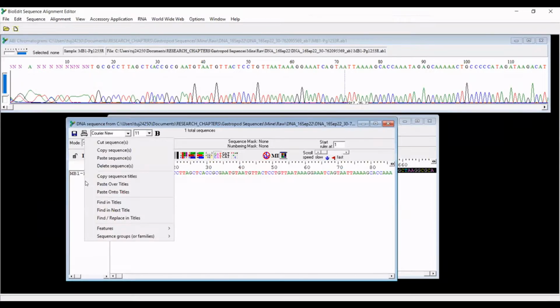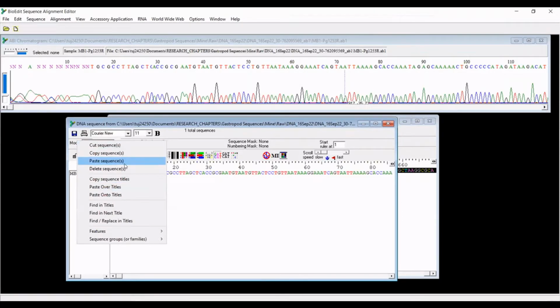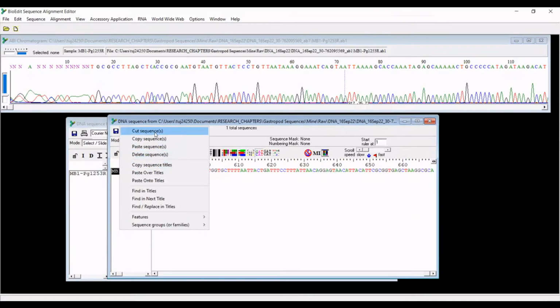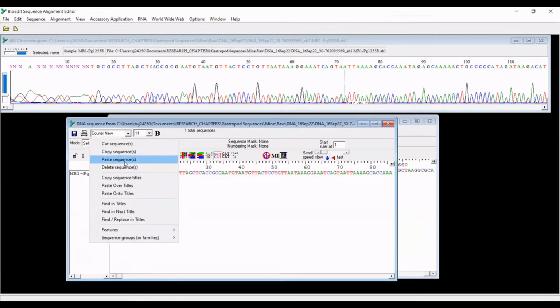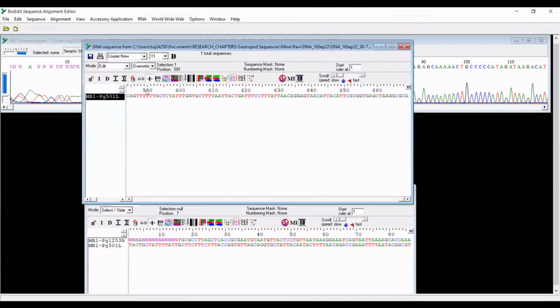So what you want to do is, oops, sorry, I'm right-clicking on this region on the left here. And I'm going to say paste sequences. And that did not work. So I think what I actually have to do is copy sequence, paste sequence. There we go. Okay. And yeah, so you can see there's no ambiguous bases at the beginning. So it has successfully copied over my trimmed file here, right? You can verify that visually. And so one thing I would recommend is to never save the changes to this raw file.